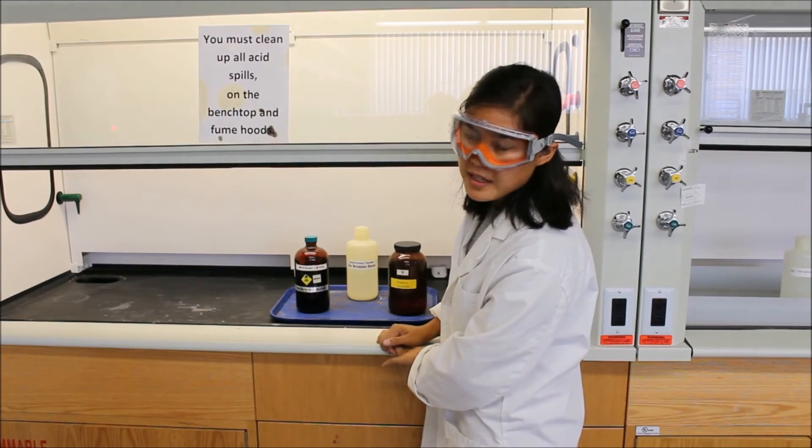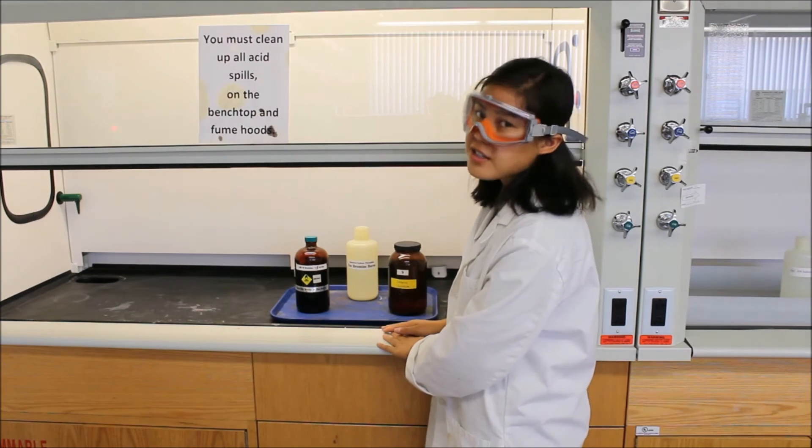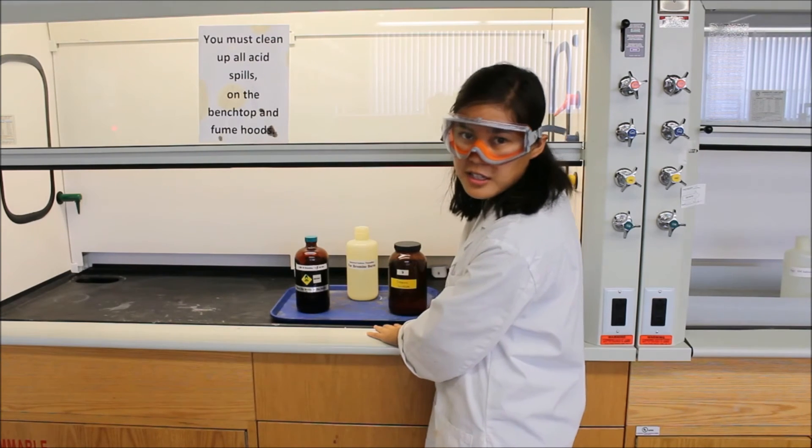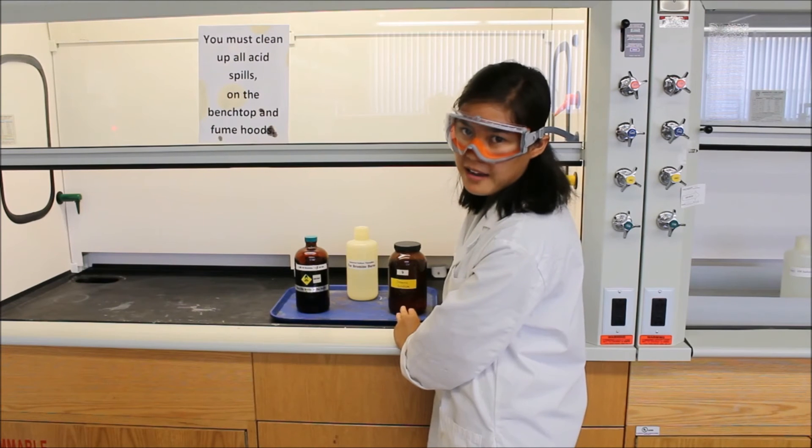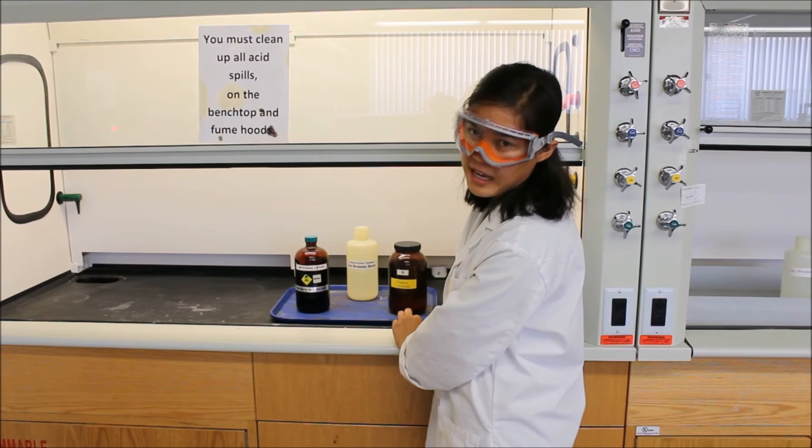So when you perform your experiment with a bromine solution, make sure that everything is done in the hood. So you'll have to take all of your setups and bring it into the hood to perform the experiment. If you don't, bromine smells really bad. I'll smell it. You'll smell it. We'll all smell it. And we'll all be pretty sad and upset.